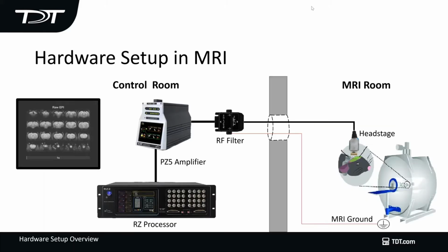And so here what we have is an example of how we've designed the systems to minimize any scanner artifact. So the first thing we do is we have our non-ferrous head stage connected to an MRI-compatible electrode. And that goes via a very long cable, up to 6 to 7 meters, into the control room, and that's connected to our RF filter. The RF filter is tied to the ground on the scanner. All right, and this basically removes almost all of your scanner artifact, as you can see over here, and then they get processed by the RZ processor.